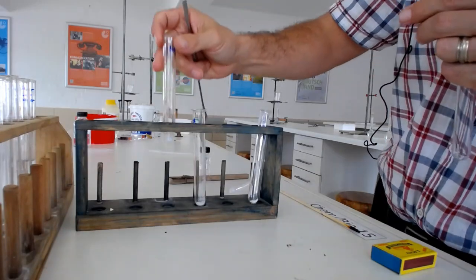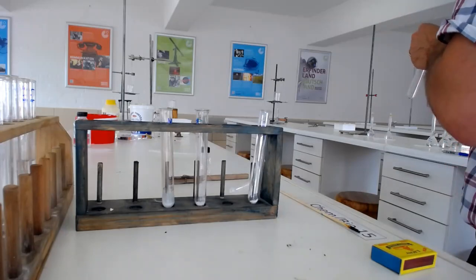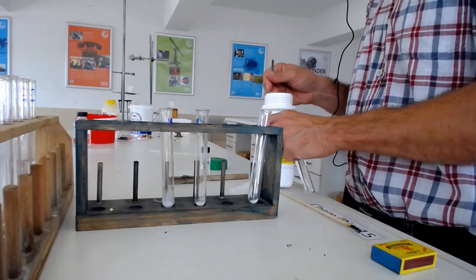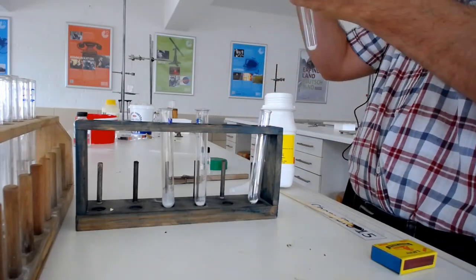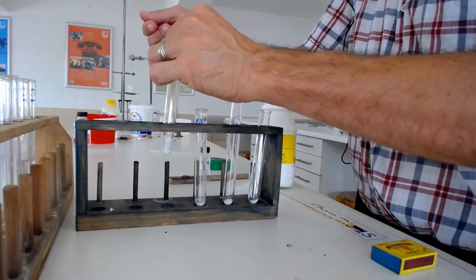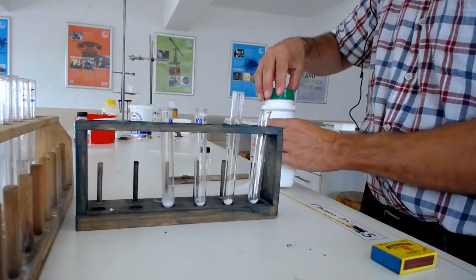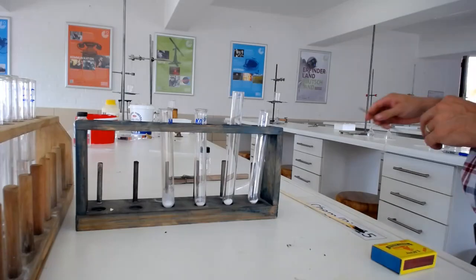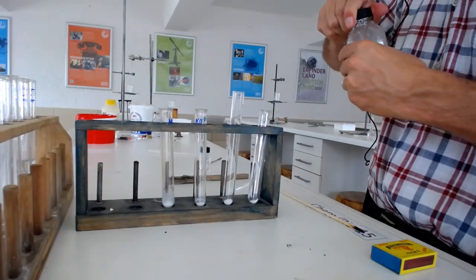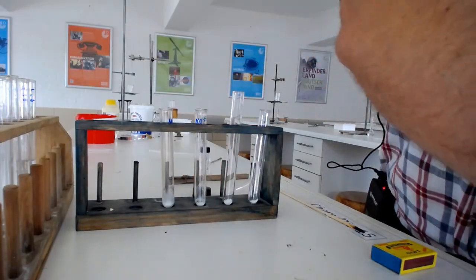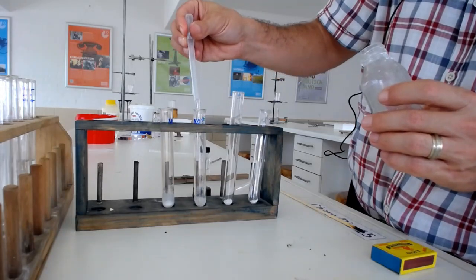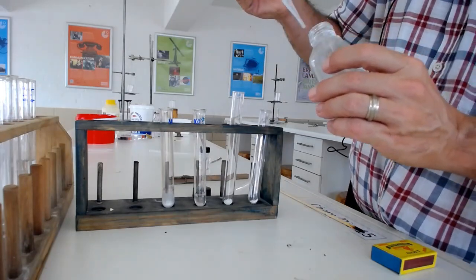Let's just put some more in there. So the first thing that we're going to do is add some sodium hydroxide to it. This is more or less the bottle that you will also have during an exam. The test for this is dissolving it in sodium hydroxide.